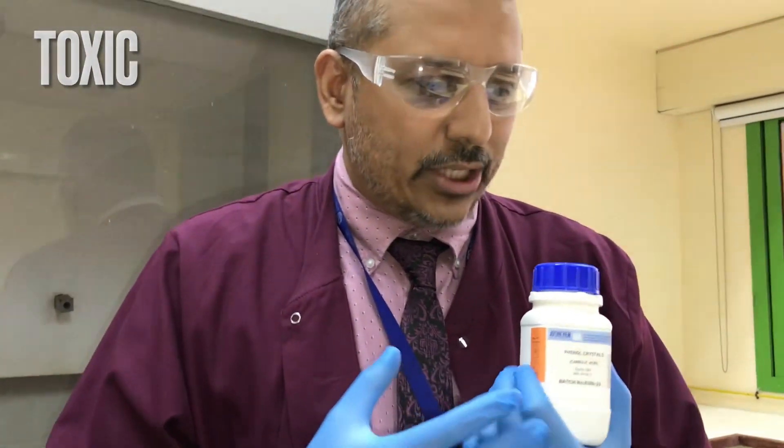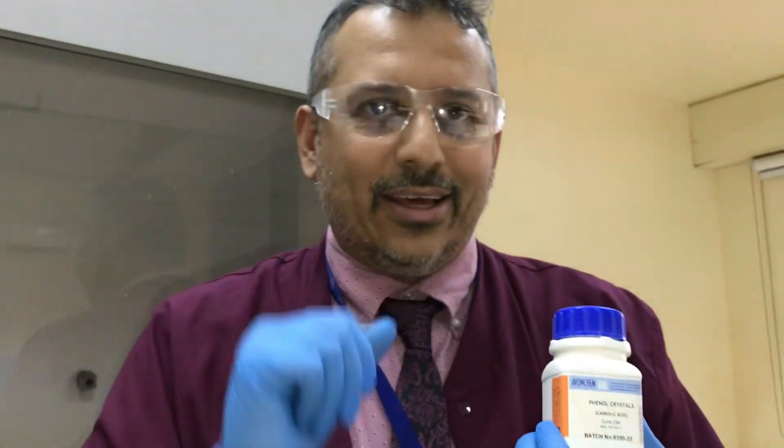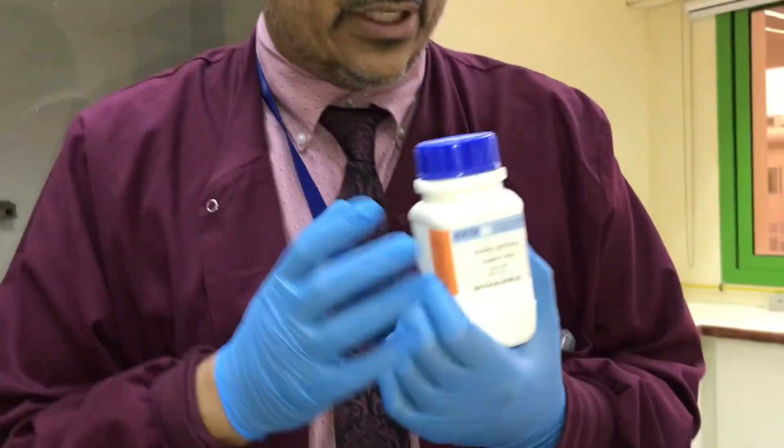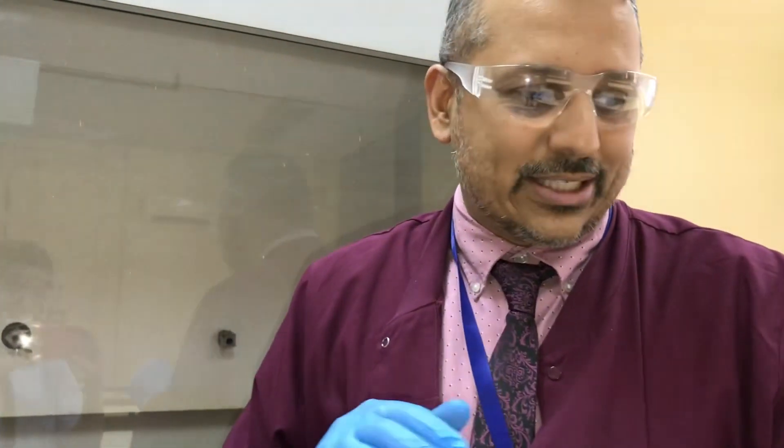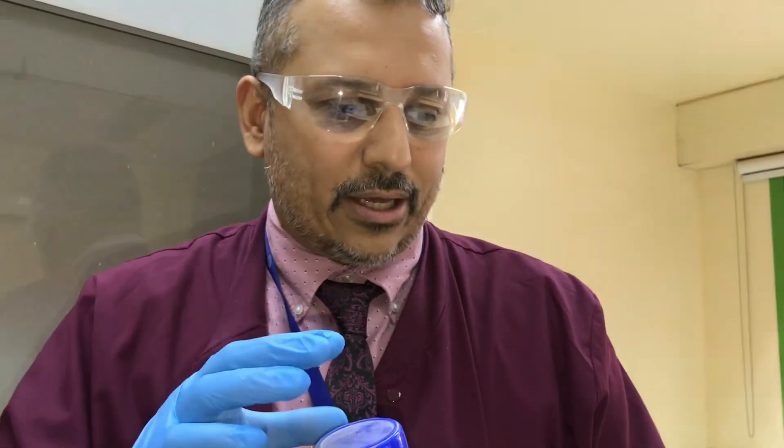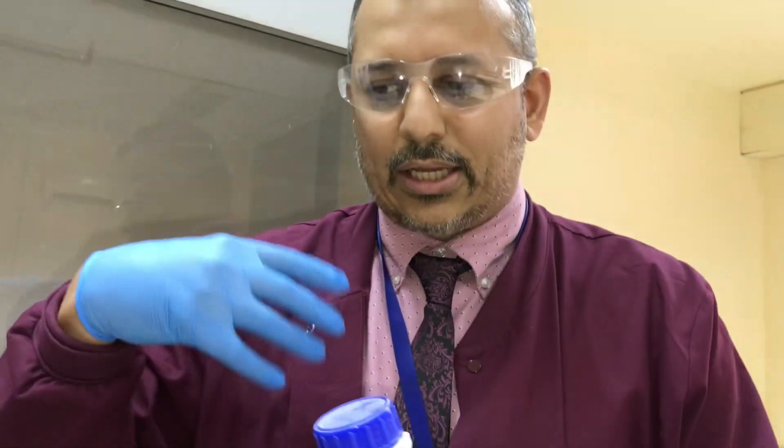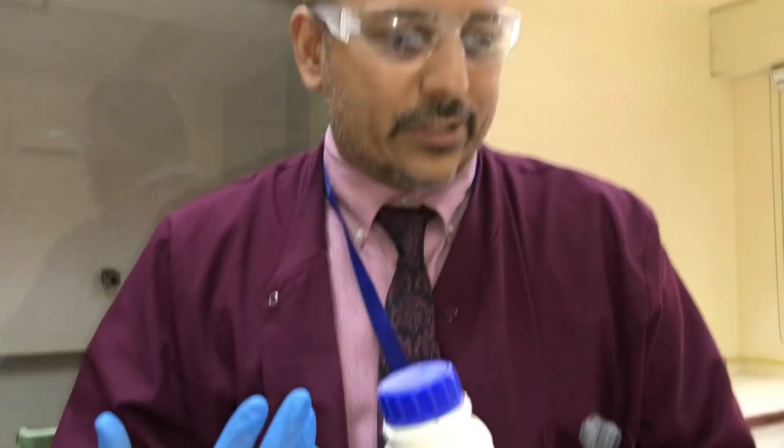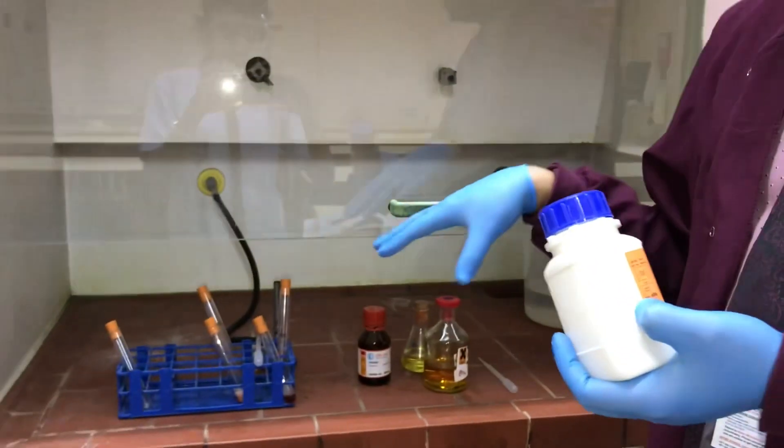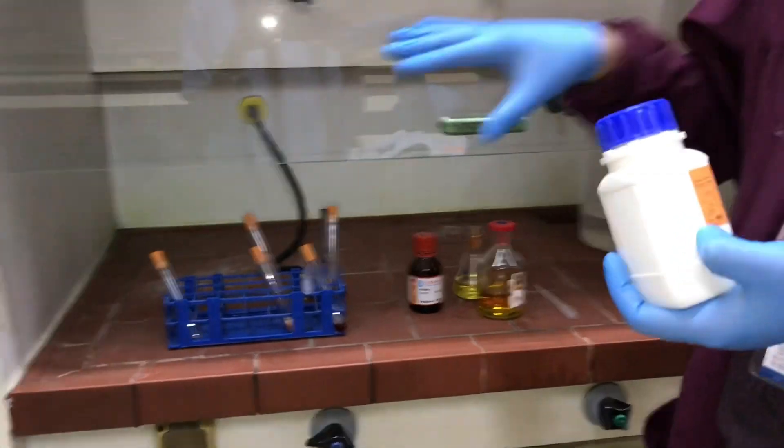It's toxic if it touches your skin—that's why I'm wearing blue nitrile gloves—and also toxic if I breathe it in. It's especially toxic if exposed to a human being for a long period of time, as it can damage organs on prolonged exposure. I want to store it away as much as possible.